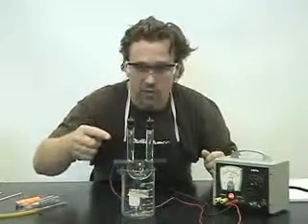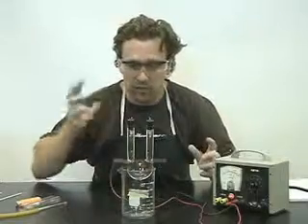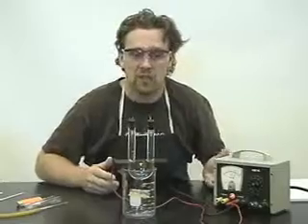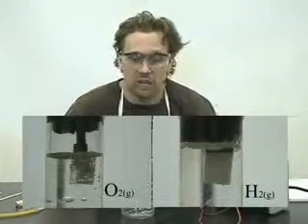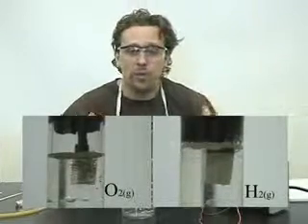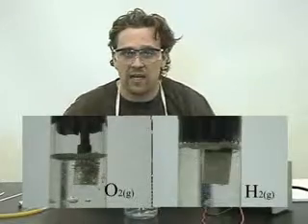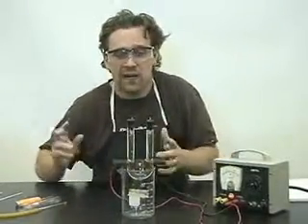Now what you'll notice is in a moment we'll zoom in, and I'll place just above me a zoomed-in version of it — hydrogen and oxygen gas being produced at their respective electrodes. Our goal is to find out where they're produced: is hydrogen produced at the positive or negative, at the cathode or anode, and vice versa.